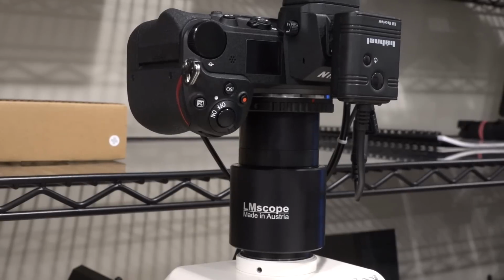Now, interfacing a really good microscope to a really good DSLR is always challenging, because you still need some optical interface between the two of them, and you want to preserve the dynamic range and the contrast and the wonderful images that the optics of the microscope can capture into, let's say, a full frame sensor. So at the top, we have a Nikon camera. It's a mirrorless, obviously has a full frame sensor there. So you really want to expose the entire area of that sensor so that you can capture as much light and, of course, take the full resolution of the camera.